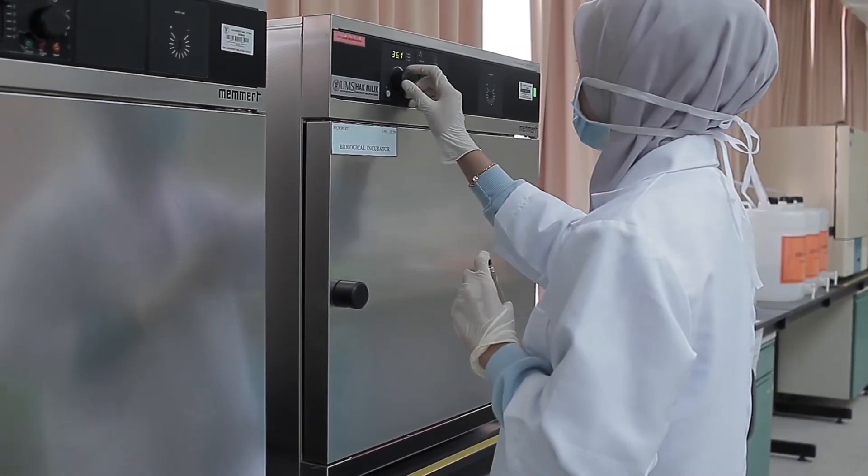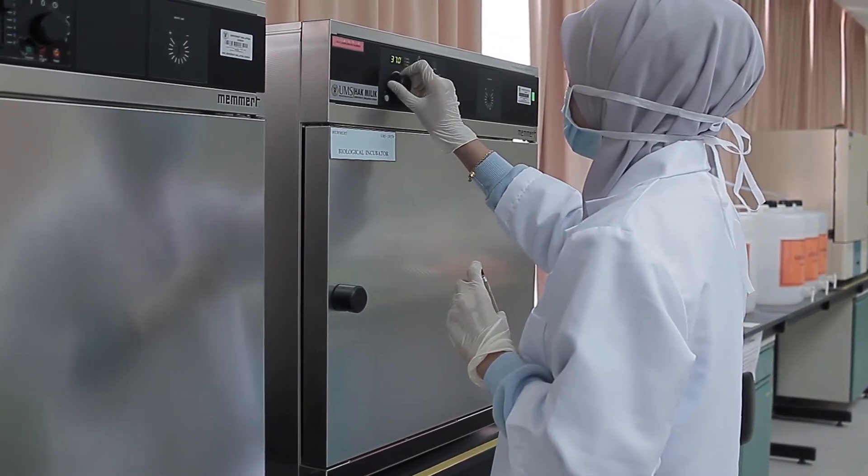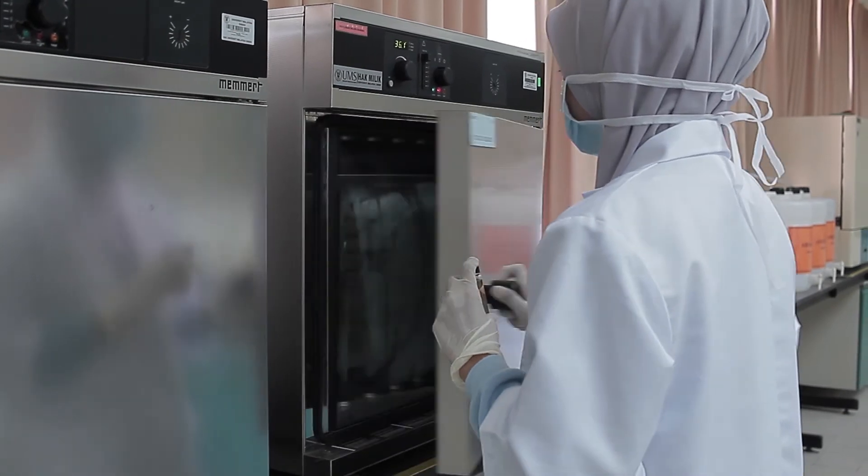Incubate the inoculated confirmation media at 35 degrees Celsius for 24 hours.